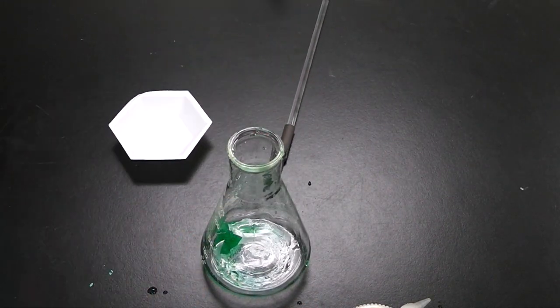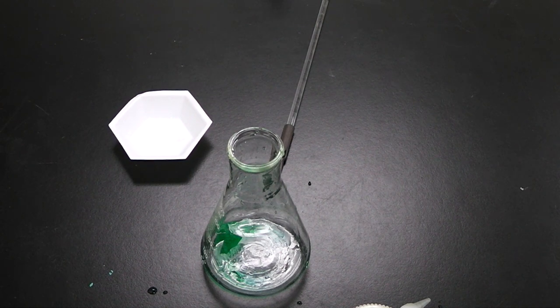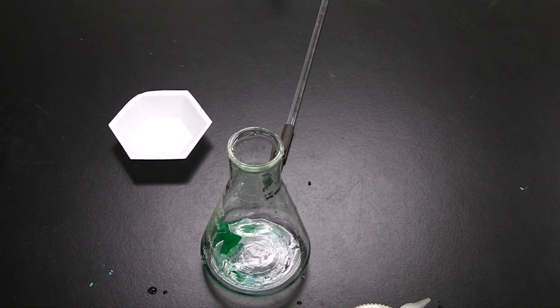And there you have it, how to quantitatively transfer a sample from a weighing boat to an Erlenmeyer flask. Good luck and have fun!